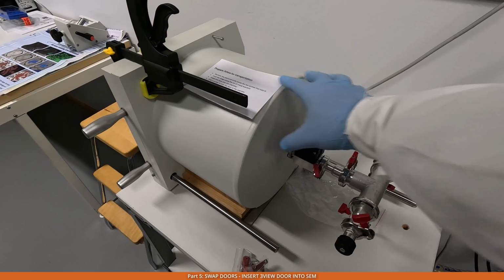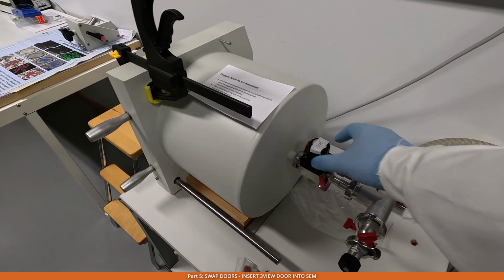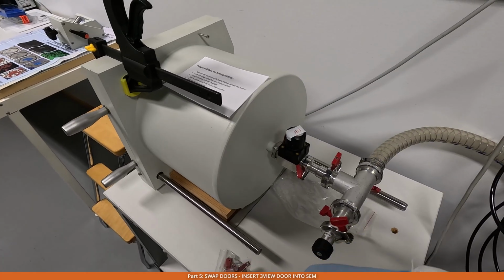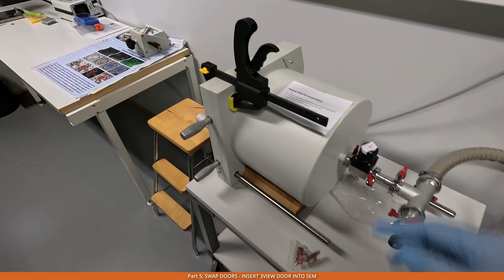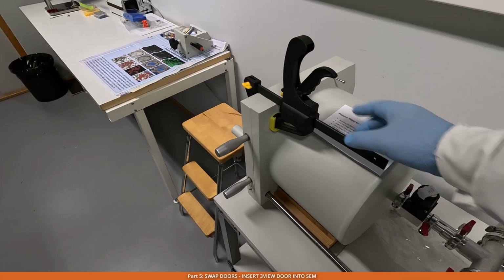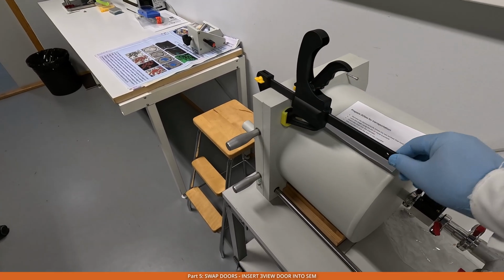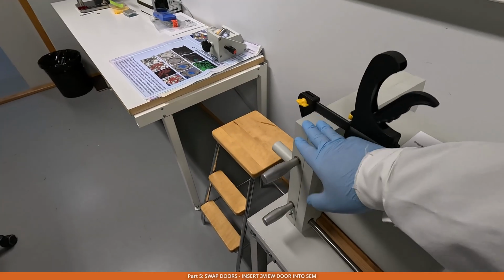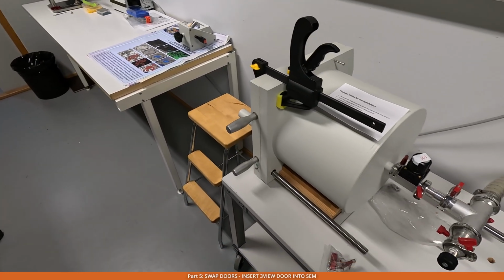In order to release the vacuum from the chamber, I undo this valve, and then the air comes through this way. Also, you can see that at the top, we use this kind of handle, like a locking thing from the mechanical shop, to make sure that the door won't get loosened in case the vacuum is lost.